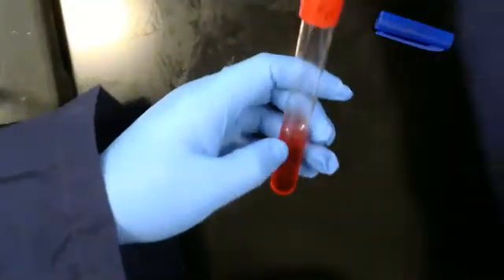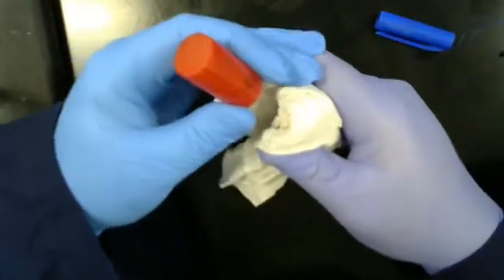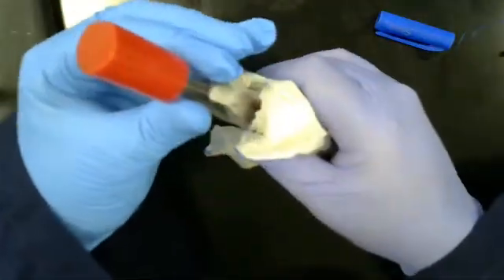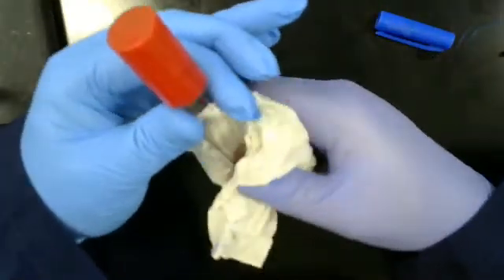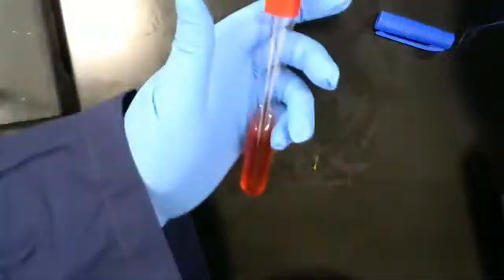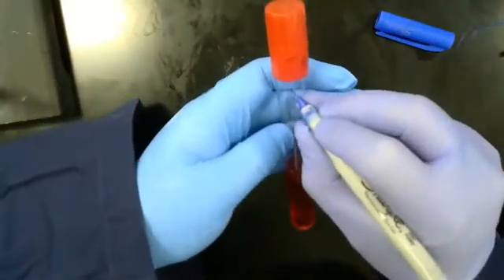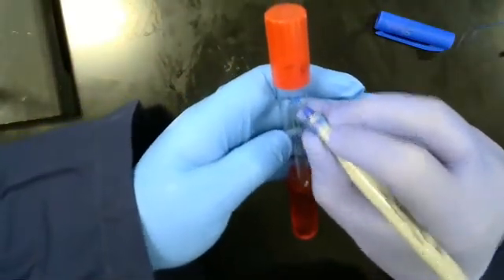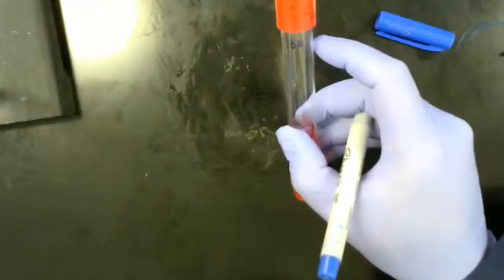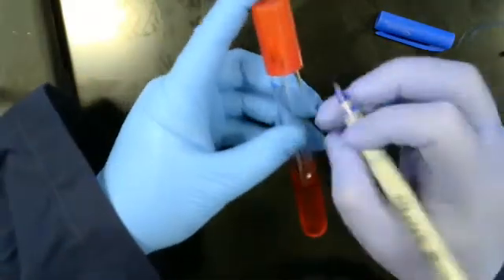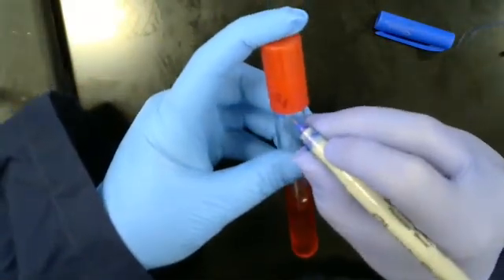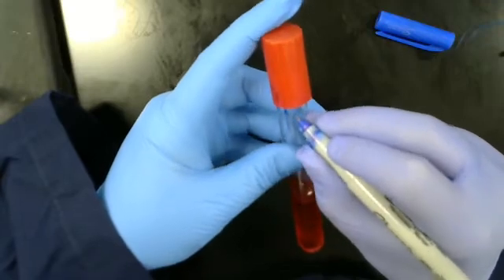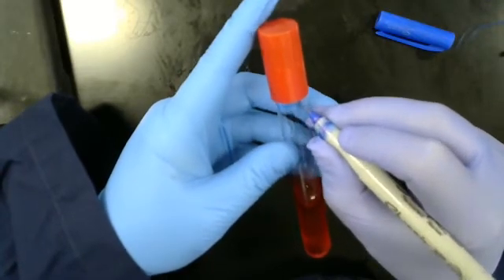Here's another. This is a broth. This is sucrose fermentation broth. Same thing as before. Staphylococcus aureus, or SA, at the top. Then the date, which is 6 January 2021.